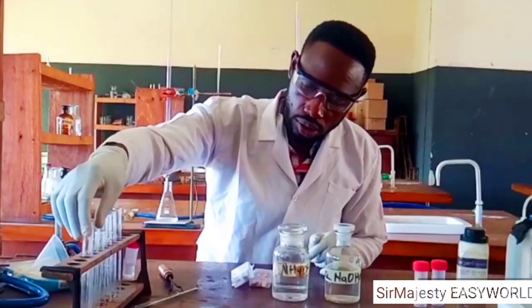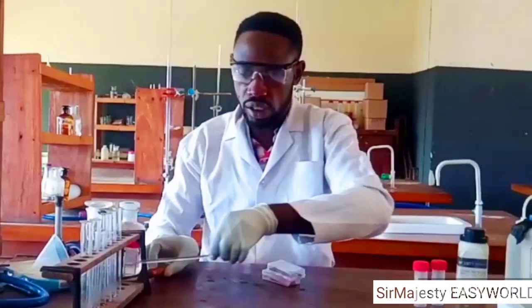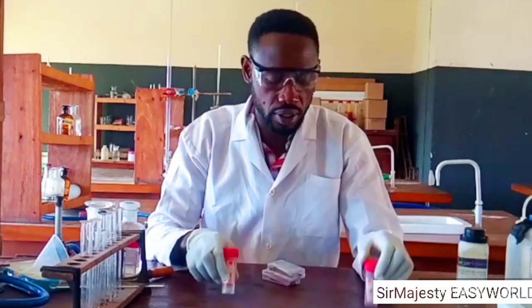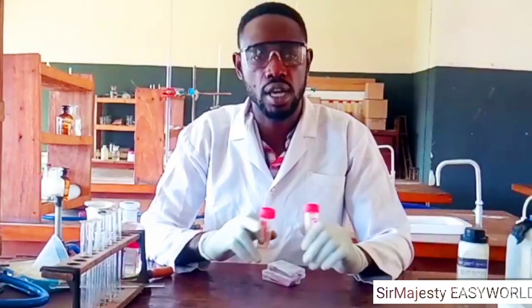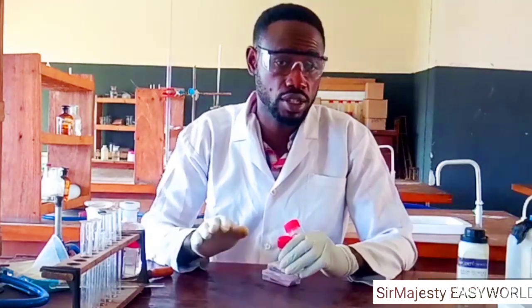First, like I said earlier, you might be faced with testing the solutions of calcium chloride and lead(II) nitrate with litmus paper. First, let us theorize what we are expected to have here. When we are asked to test a solution of a salt with litmus, they are just teaching you nothing but salt hydrolysis. Just some salts, when dissolved in water, hydrolyze to give an acidic solution, but they are normal salts.